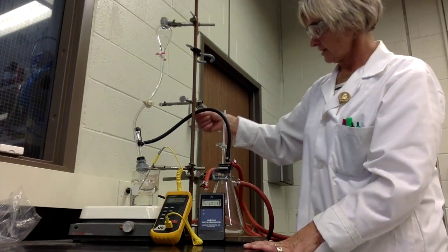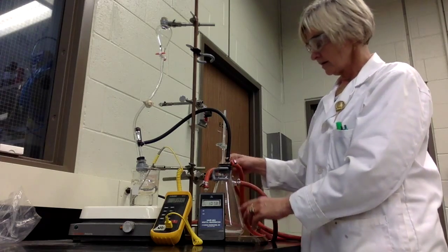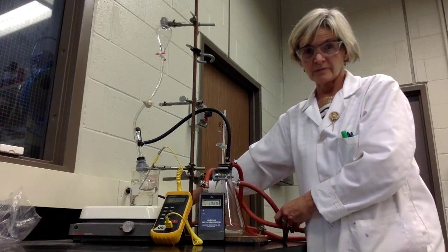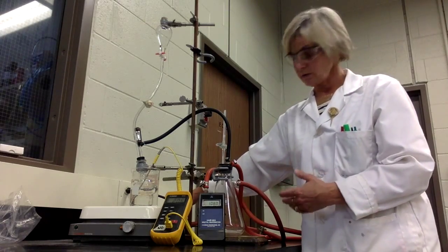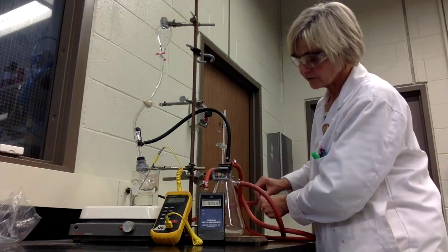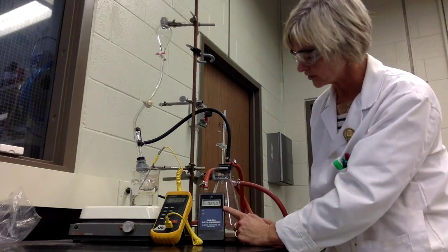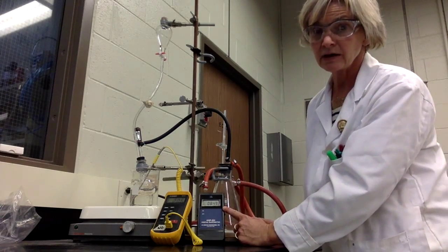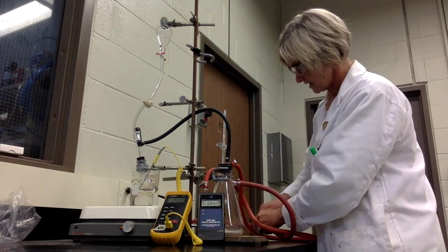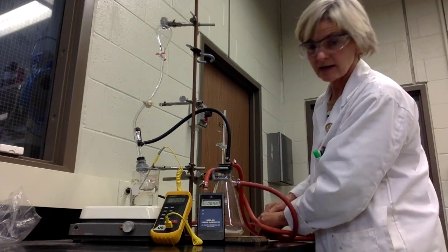If you follow the black line here, it makes its way to the evacuation chamber, and that is ultimately hooked up to the vacuum from the college. So what we're going to do through this experiment, via the vacuum that's allowed through the system, is drop to a very low vacuum pressure. Right now it's reading about 85 millimeters of mercury. Once you get to that range, you should be able to close this pinch valve and try to maintain that pressure.